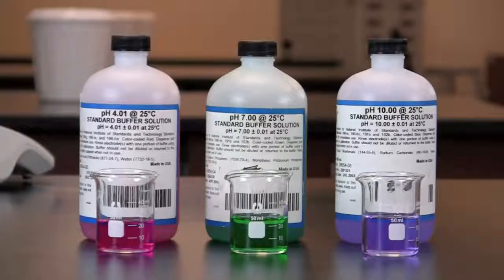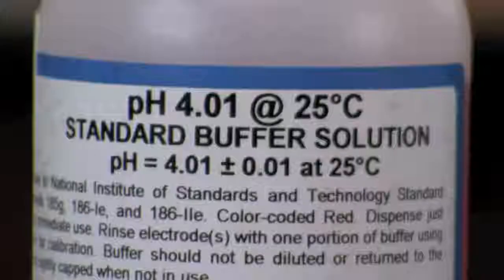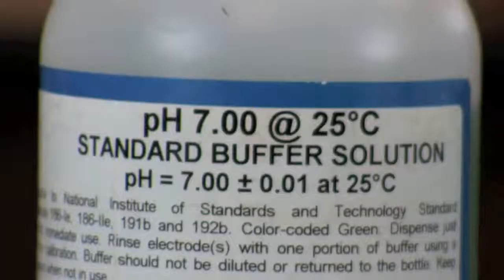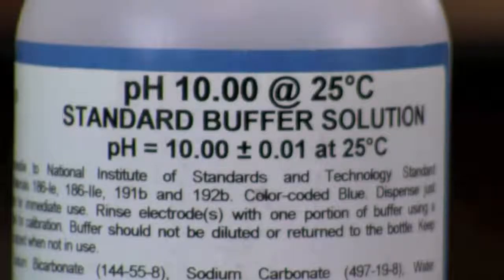Prior to use, a pH meter should be calibrated using color-coded buffers of fixed pH. pH 4, 7, and 10 are standard.